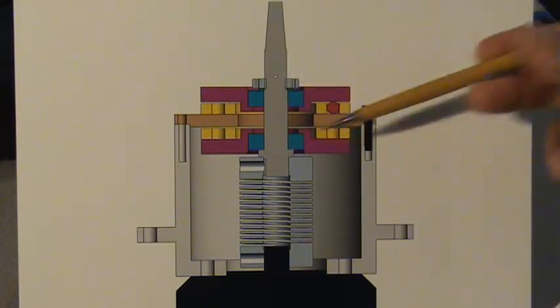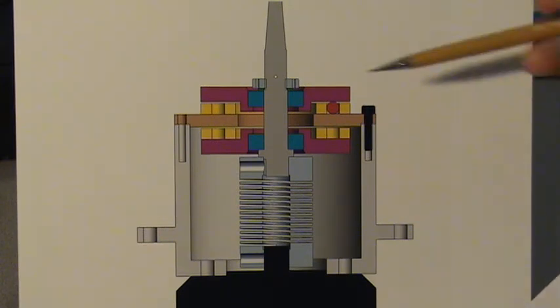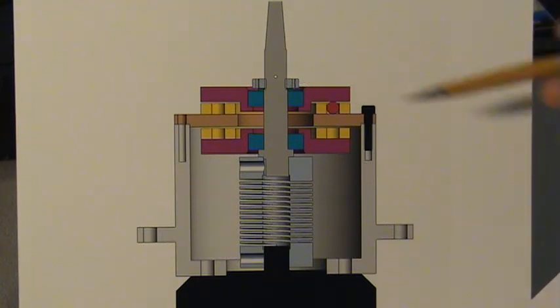The center drive shaft serves multiple purposes. It transmits torque from the motor through the flexible coupling to the rotor mounted at the end of the shaft here. It is also a bolt threaded at this end. It holds the entire assembly together by means of a nut located here. Notably absent are springs, elastomers, sensors, or computer interfaces. It is strictly mechanical. Rotor-Mate technology is scalable up and down to accommodate all centrifuge rotor applications.